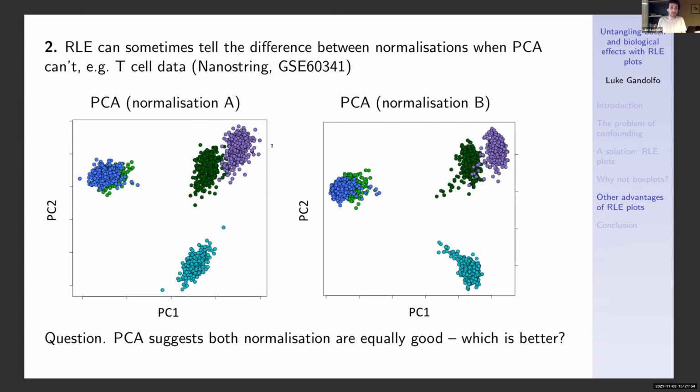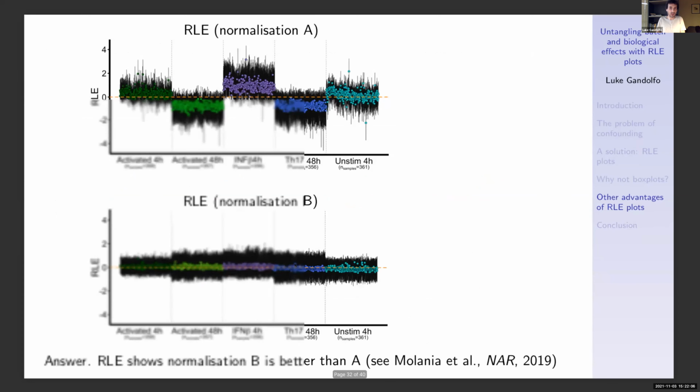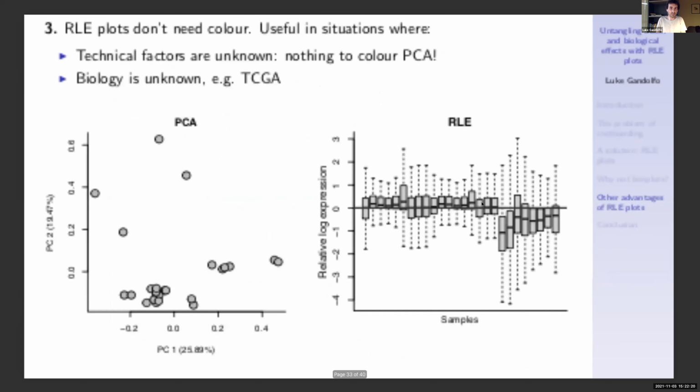So here's some NanoString data and 2 different normalizations applied to it, A and B. Both look great, and indeed both look equally good according to the PCA. So the question is, which is better? Well, an RLE plot reveals that B is much, much better than A. And indeed, we know B is much better than A for a host of other reasons, and I'll refer you to this paper for those other reasons.